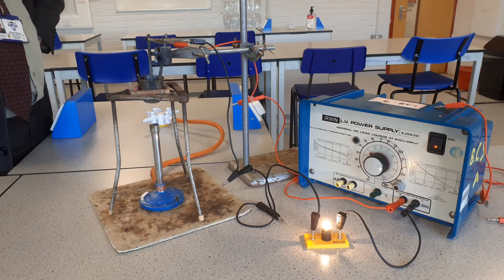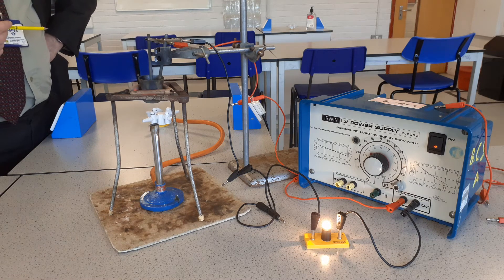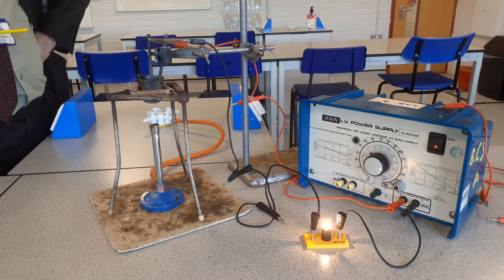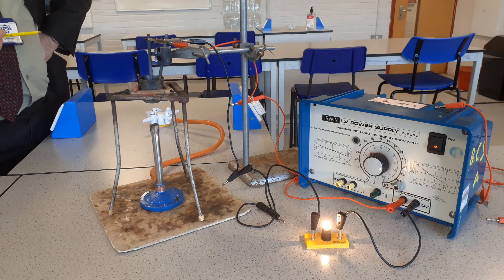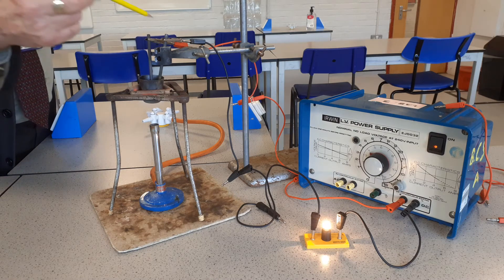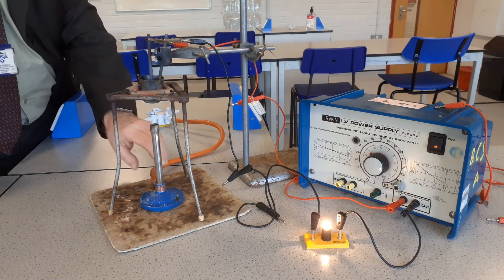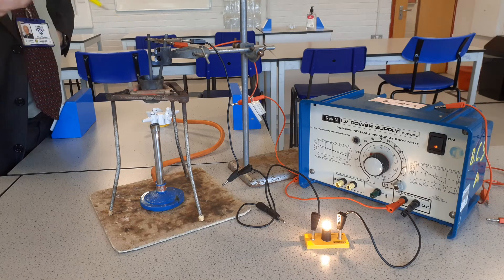Now, we've only got two ions in here — we have a lead ion and we have a bromide ion. The lead ion has a positive charge and the bromide ion has a negative charge. Because the lead ion has a positive charge, it will move towards the negative electrode — that which is connected to the black lead — and that is the cathode. The bromide, which has a negative charge, will be attracted towards the positive electrode, which is the anode.